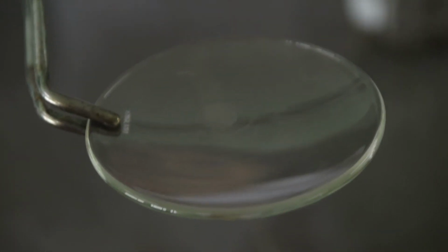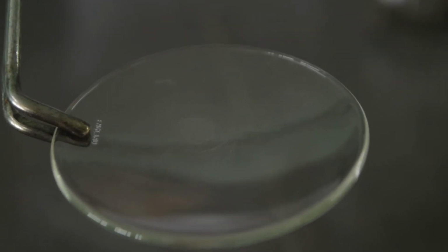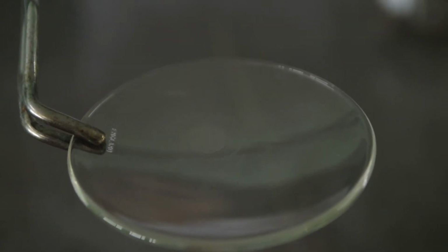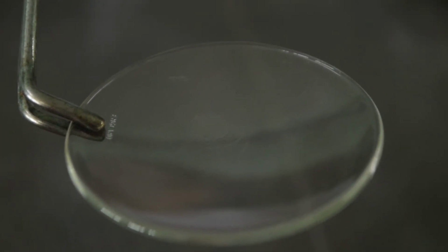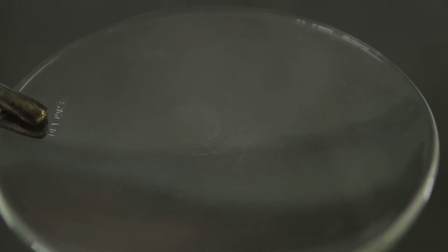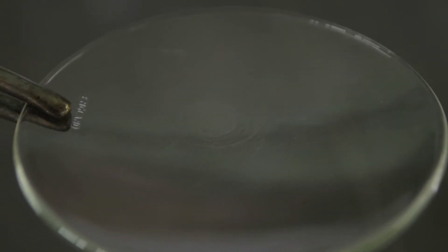This is already the mixture of the distilled water and the ammonium hydroxide. I want you to observe what happens. Is there a residue left? What do you mean by volatile impurities?